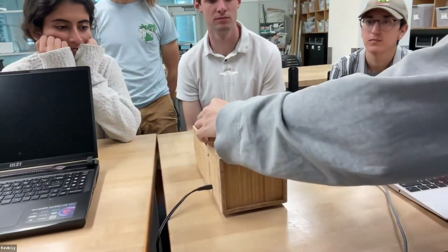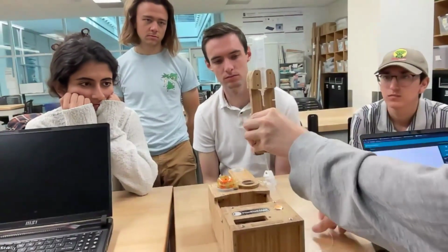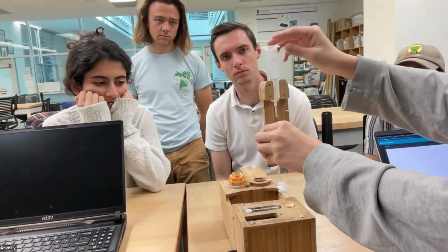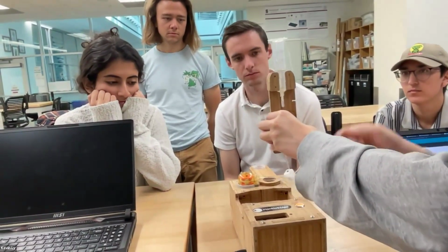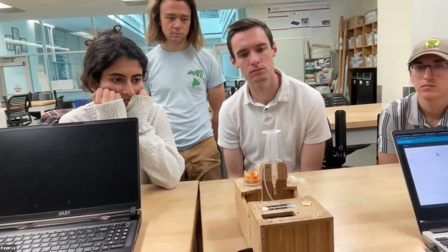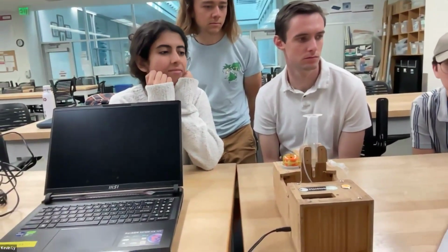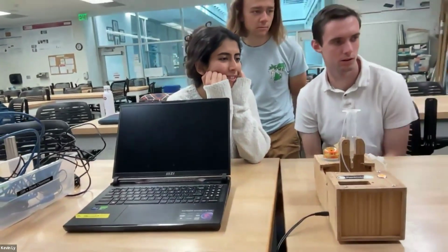It goes into this capillary tube that all the particles flow through as they get sucked through this tubing by this pump. That's just a peristaltic pump. As the pump pulls things down the tube, the particles pass through this glass capillary tube, which we call a flow cell. And we have a camera that can watch everything that passes through.